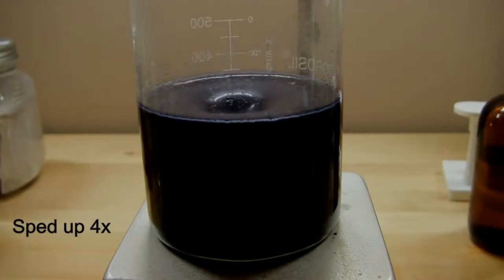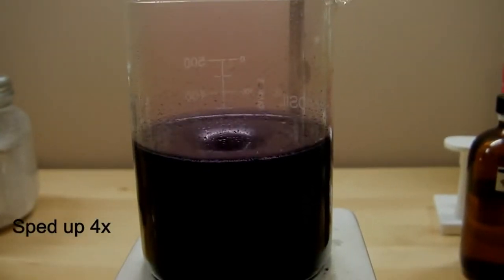You may also have noticed that it produces some gases too. This is oxygen, which is one of the products of the overall reaction. And now, if you'll look over the surface of the liquid, you can see that it's sort of darkening a bit. And that's because at this point in the reaction, it's pretty much done oscillating, and now it starts producing iodine vapor.